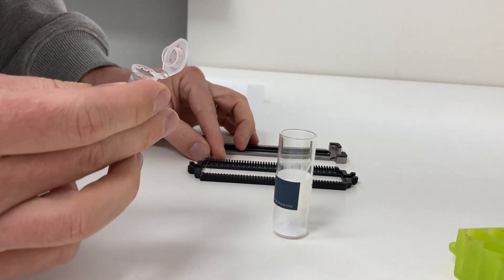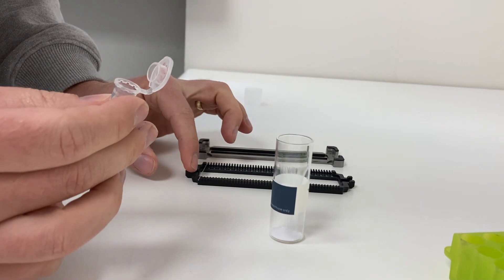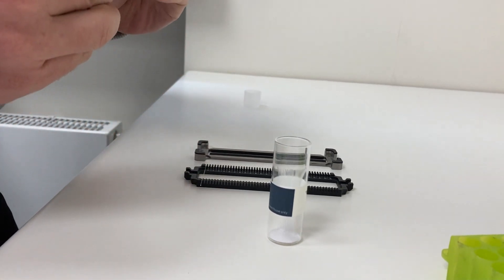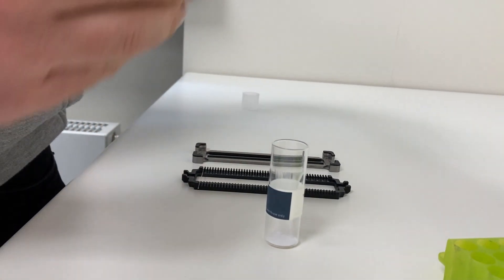You can measure up to 48 samples in parallel using the Prometheus instrument.